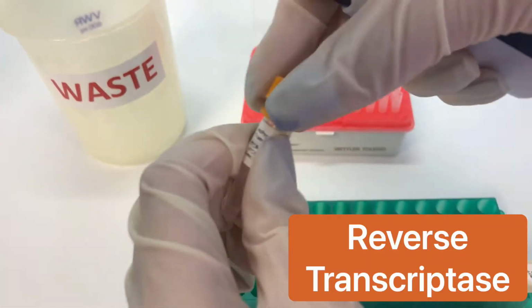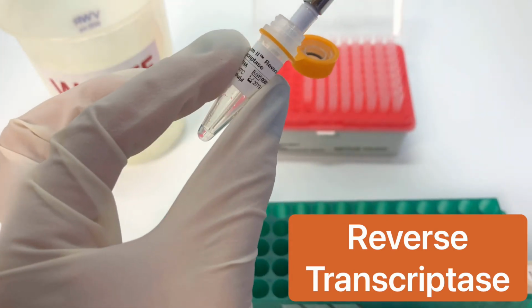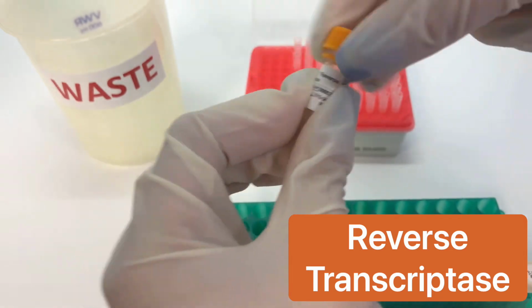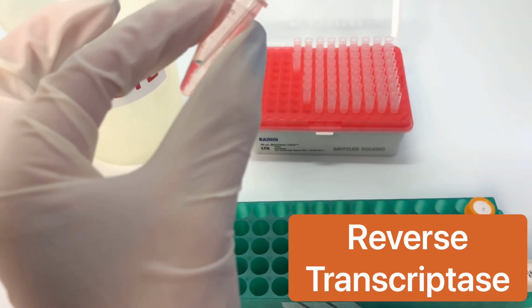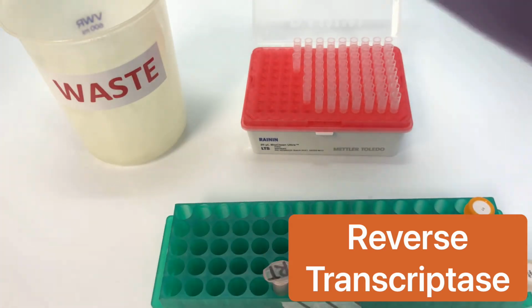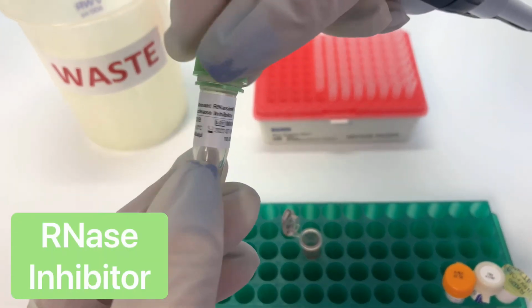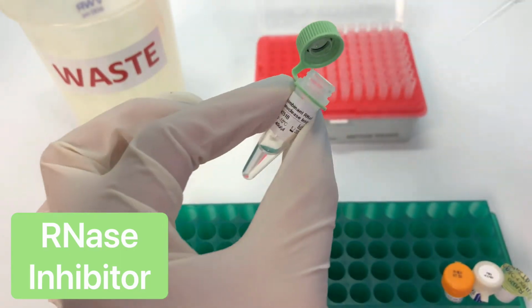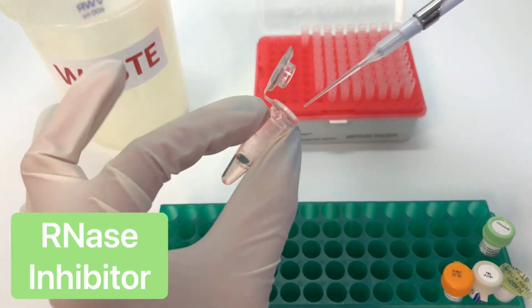Now it's time to add our enzyme, reverse transcriptase. The liquid can be quite viscous, so pipette up and down to mix. And lastly, we will add our RNase inhibitor. This solution is also viscous, so you will need to pipette up and down to mix.